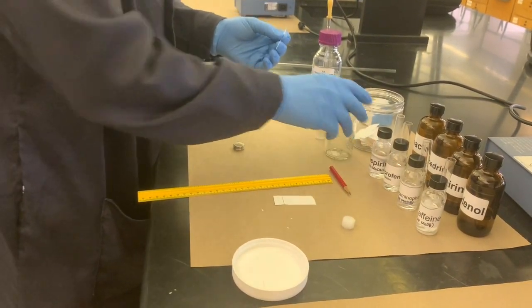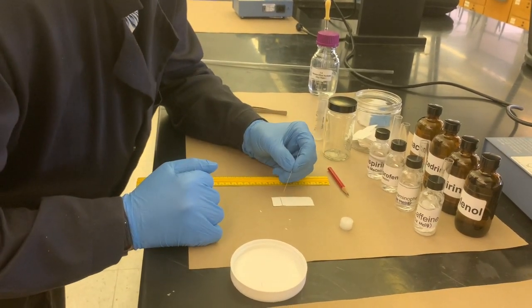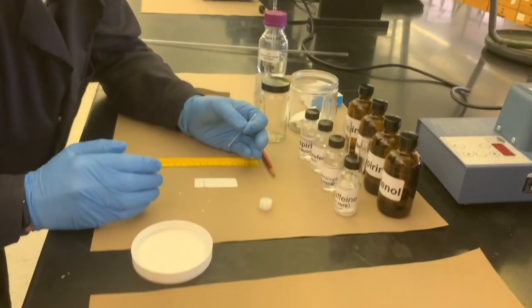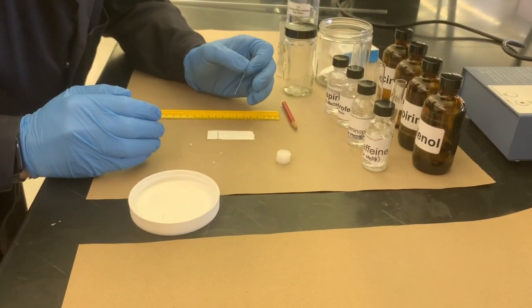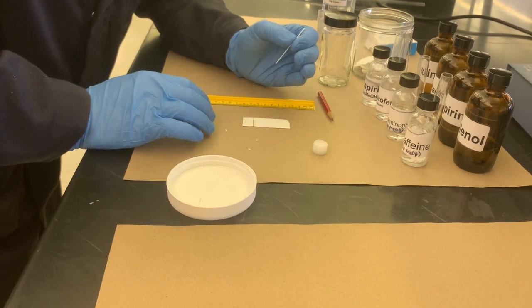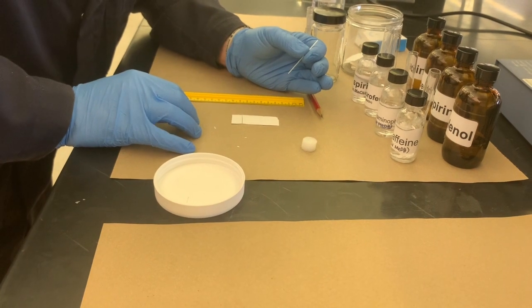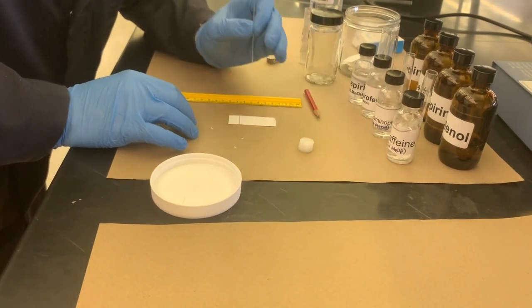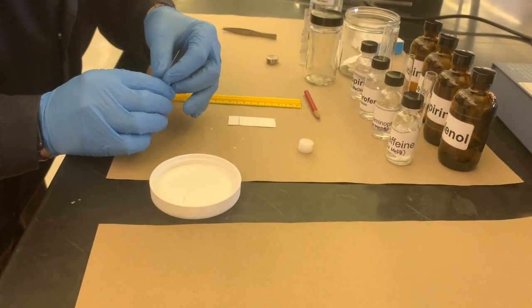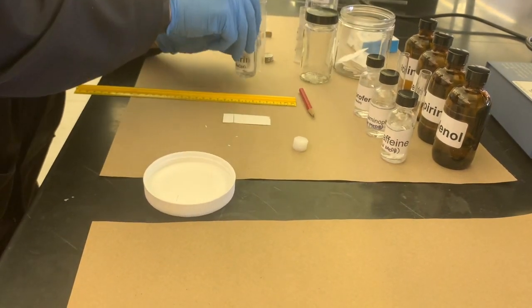So you have these fresh capillary tubes, and they're ready to go. And now we're going to look at our samples. So ideally, you would pour a smaller sample out of these and put it into a container for yourself and label it. But today I'm going to use an individual capillary tube for each of the samples, so we don't have to worry about that. You want to be very careful to never contaminate any kind of pure samples. If you're moving from, let's say, the aspirin to the ibuprofen, you don't want either of those to mix, right? So we're going to start by blotting the aspirin.